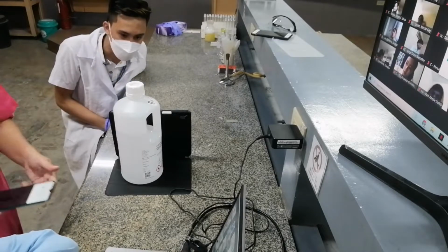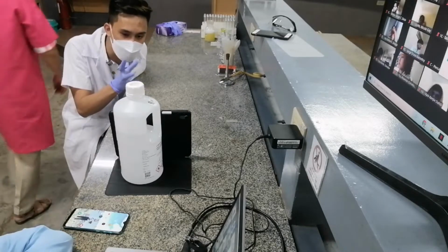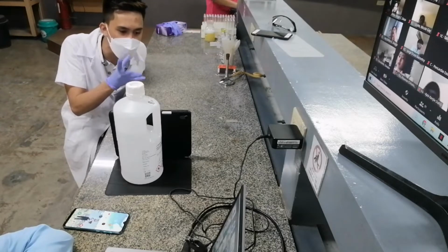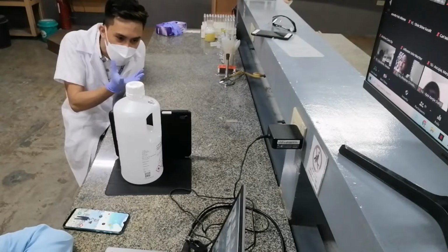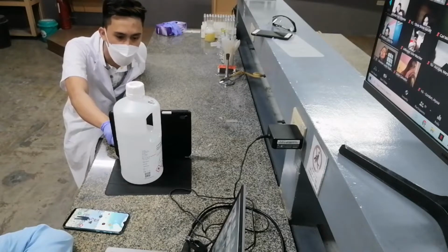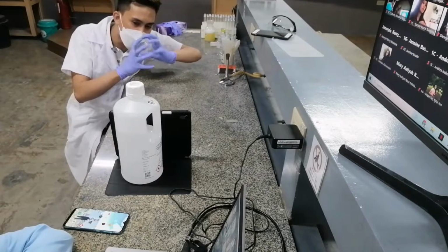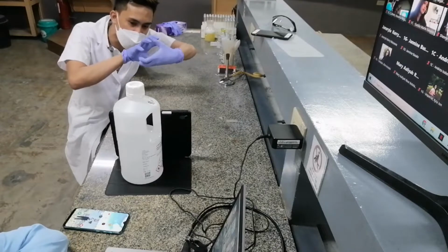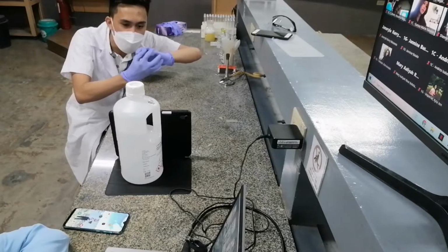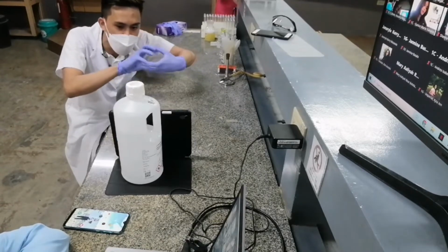So why is that? That is due to the fact that the proteins in the egg white undergo a specific change. The specific change in the structure of your egg white is known as denaturation. When we say denaturation, class, if you remember, a protein contains a 3-dimensional structure. Denaturation is simply changing or disrupting the 3-dimensional structure.